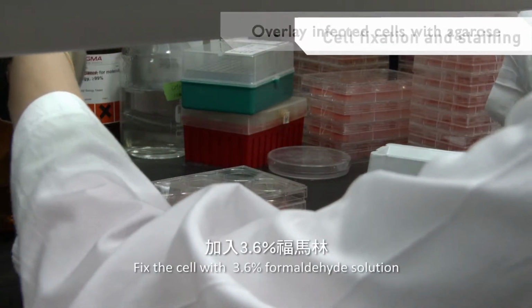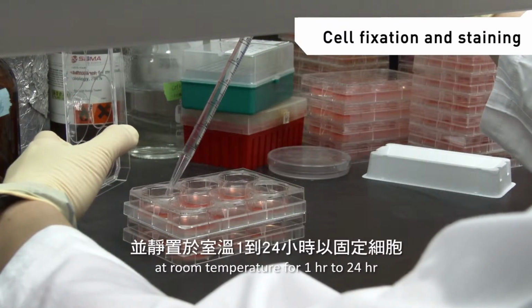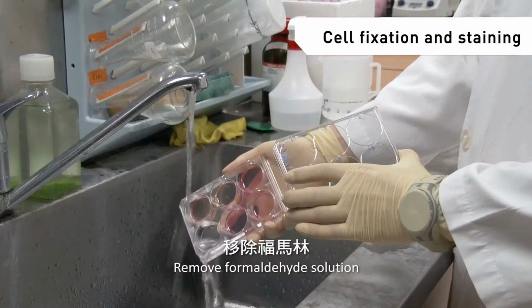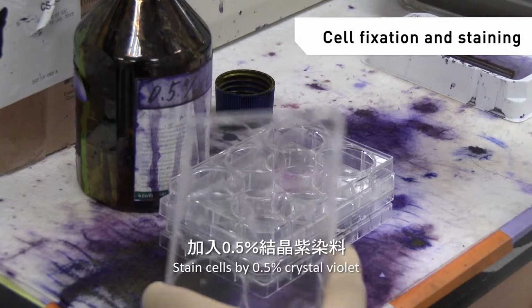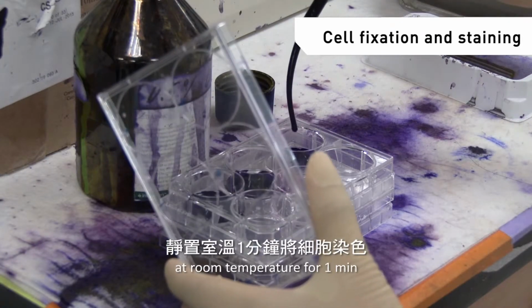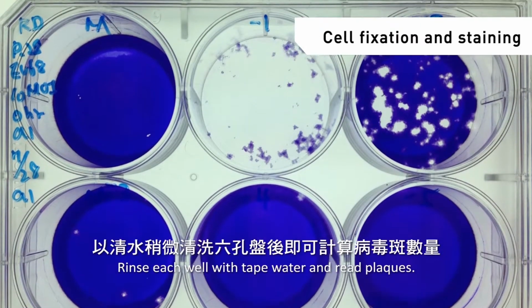Fix the cells with 3.6% formaldehyde solution at room temperature for 1 hour to 24 hours. Remove formaldehyde solution and wash out the agarose overlay. Stain cells with 0.5% crystal violet at room temperature for 1 minute. Rinse each well with tap water and count plaques.